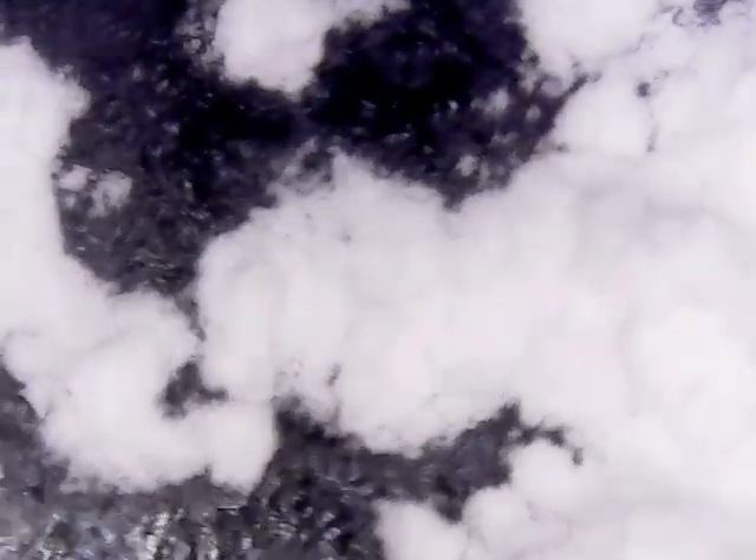Let's get this in focus. Or is that in focus? Is that in focus? As is. It looks like the lens is a bit cleaner, but is that in focus? As is.